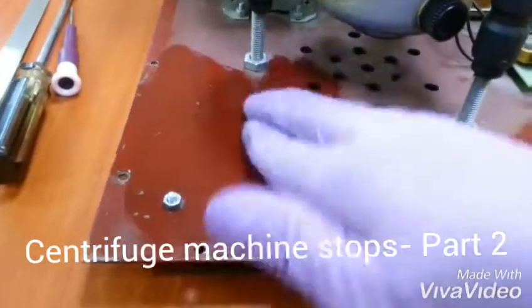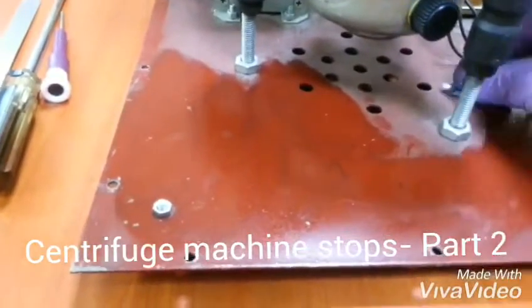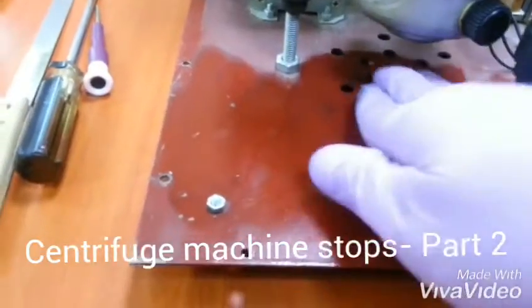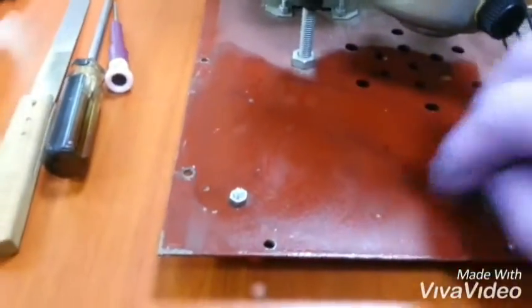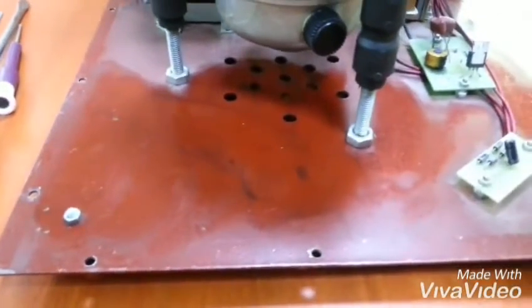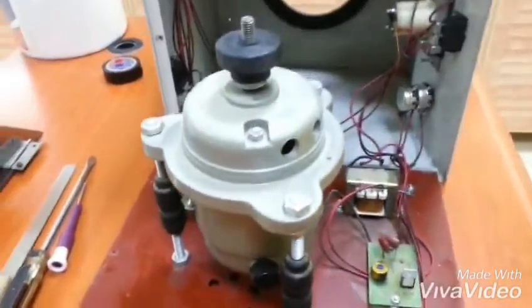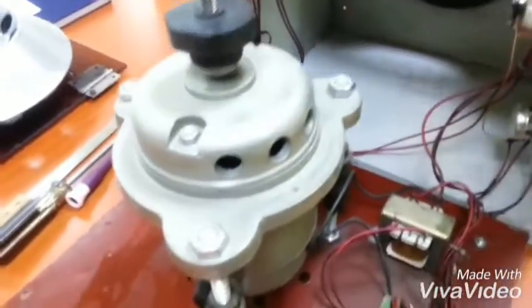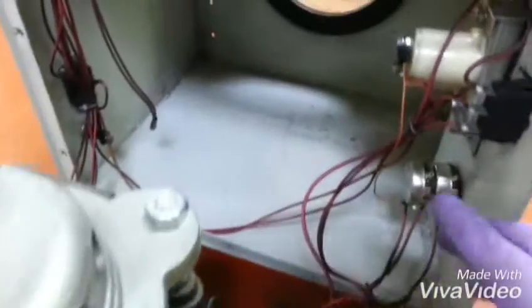Was this machine very dirty. So this is what you can see inside this machine. This is the motor. I don't know why it's not working, and then as you see, all the wiring is still good.